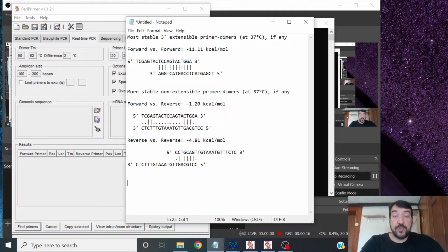Let's get into it. qPCR needs to be efficient, and in order to get really efficient PCR reactions, software will help you pick primers that you can't just pick by eye and manually. For example, here's a pair of primers that are actually not very good. You can see that software can show us that these primers form a lot of base pairs with one another, and they actually have a favorable thermodynamics for this dimer to form. These are other dimers that could also form.